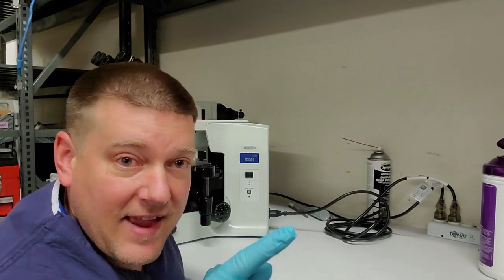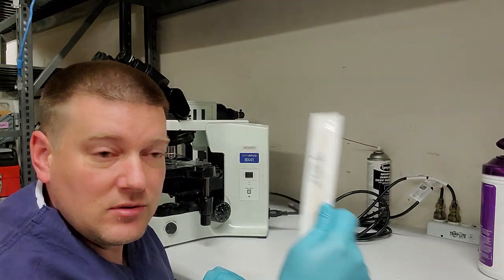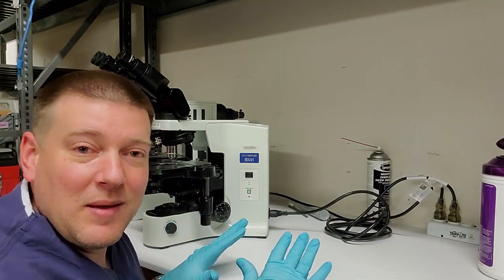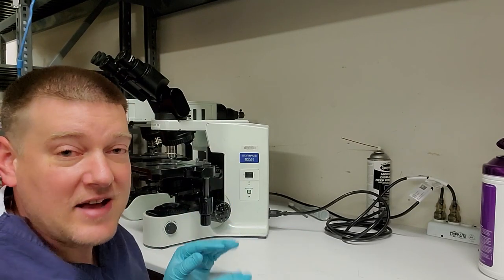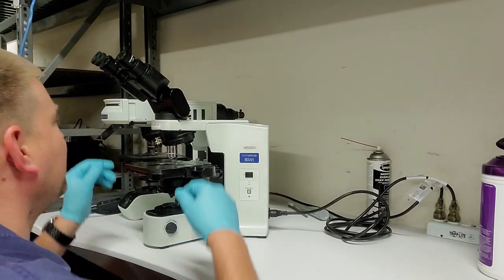Do not lay an oily or dirty rag or consumable on your table because you're going to touch the table with your gloves, you're going to contaminate the glass. Notice the trend here, guys. Do not contaminate the glass. This is a huge thing, okay?